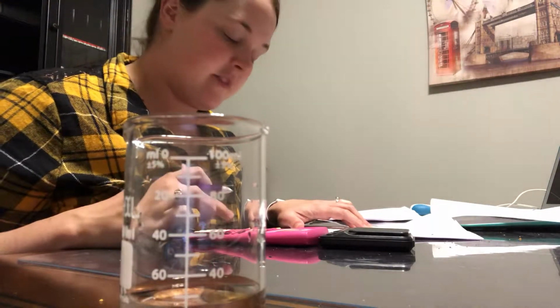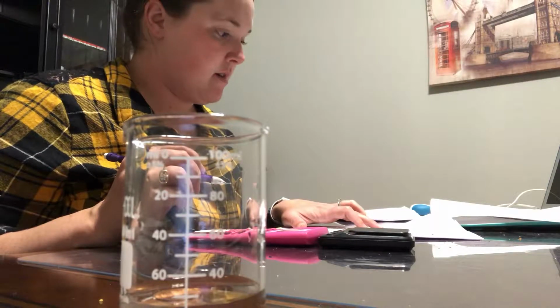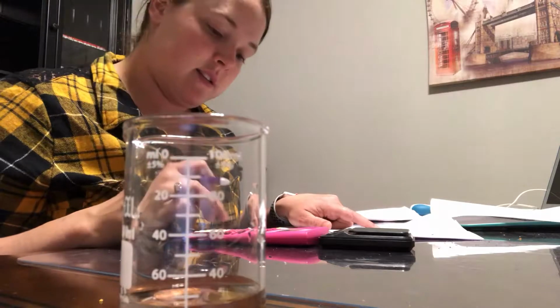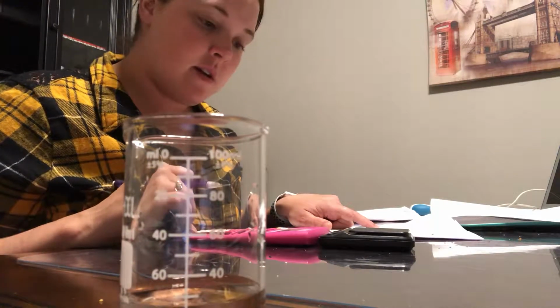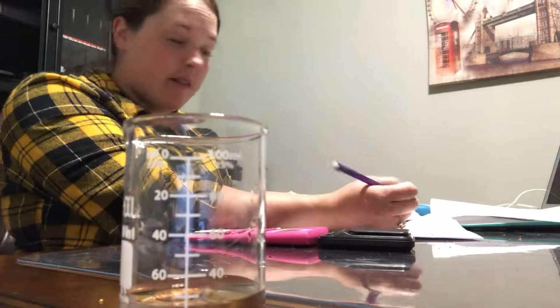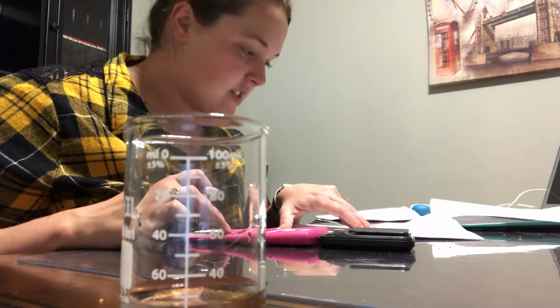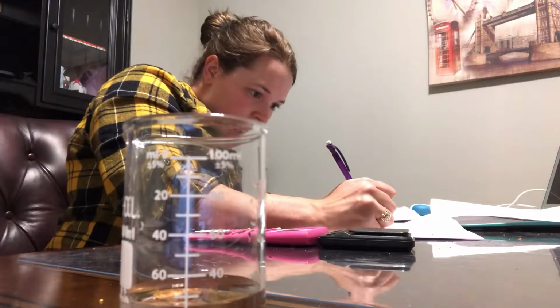52.48 is going to be B4, because that's the mass in B3 plus the next 5 pennies. And then C4 is going to be 52.48 plus 13.12, and that's going to be 65.60. We're going to say it's going to go up another milliliter, so 29 milliliters total. So it'd be 65.60 divided by 29. That's going to be 2.26.